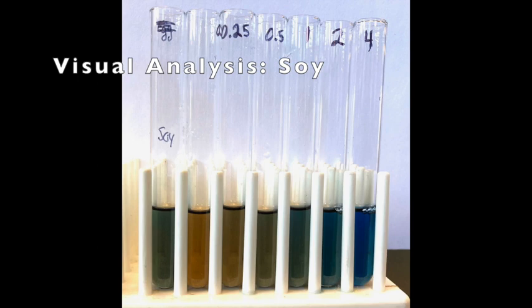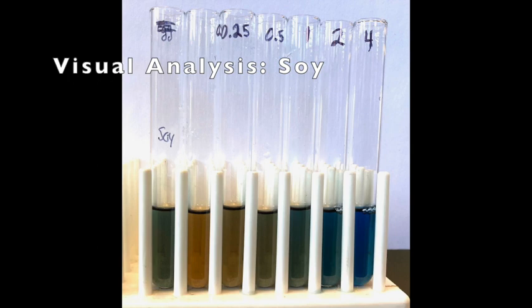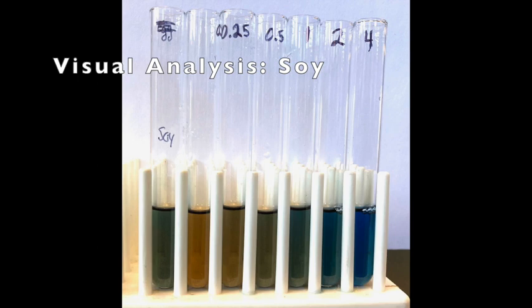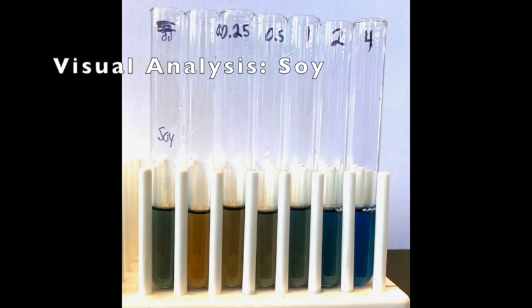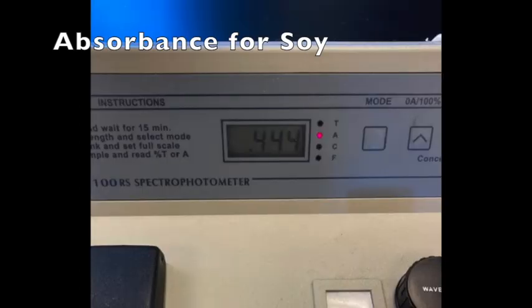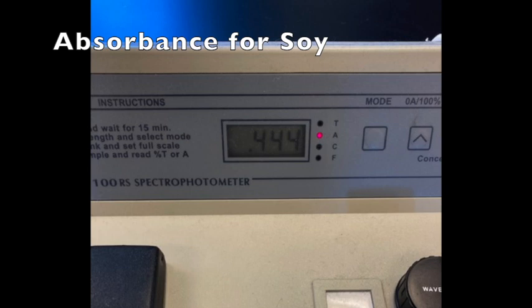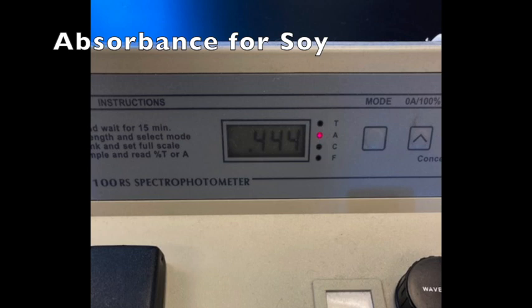For each protein source, in this case soy, you will do a visual analysis first. Write soy on the first line of the notebook as your first protein source. In the visual analysis column, compare the color of the soy tube to the colors of all of the protein standards and figure out where in this ranking it fits — is it between 0.25 and 0.5, or between 1 and 2? Try to assign it a number based on visual analysis. Then record the absorbance from the spectrophotometer for soy, which is 0.444 AU.